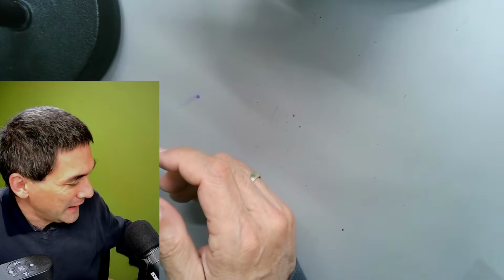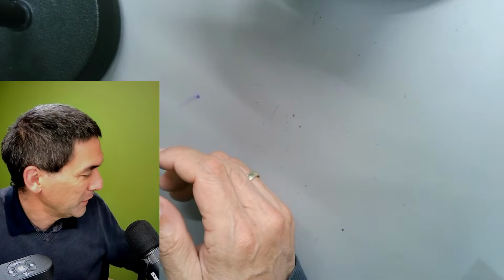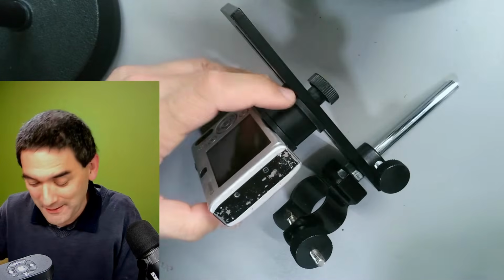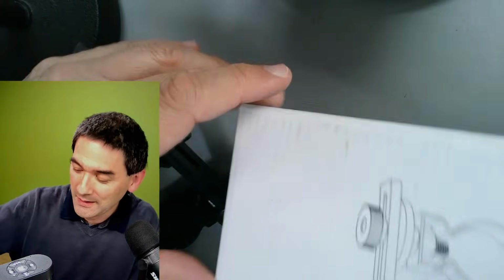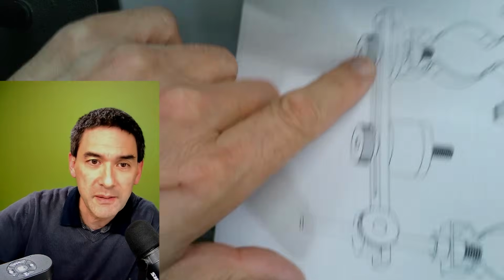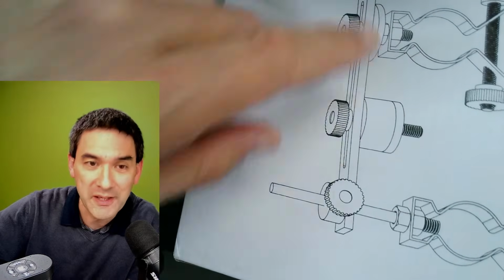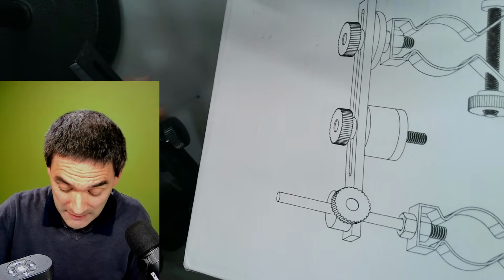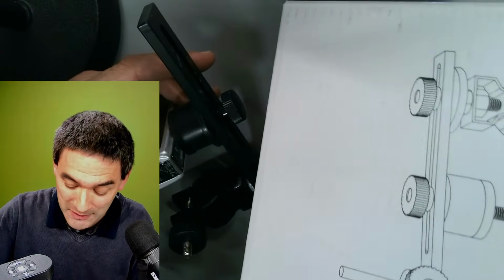When I ordered that, I had to laugh a little bit because it's so, under quotation marks, how shall I say this? It's very German. Fully made of metal, zero tolerances, absolutely functional design. It's called the Digiklemme. It's a company that also sells telescopes, and that's basically the drawing. It comes with different size adapters, and this is by far the most stable adapter that I have. It's not even close. It's the most stable adapter that you can possibly imagine.